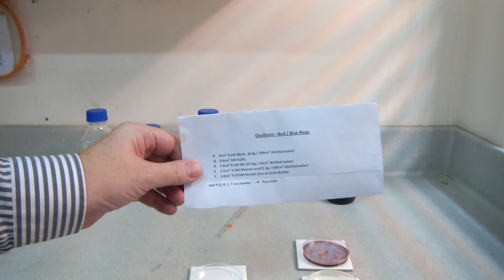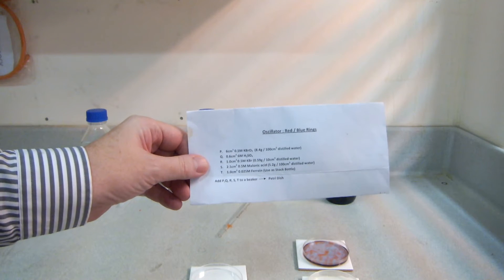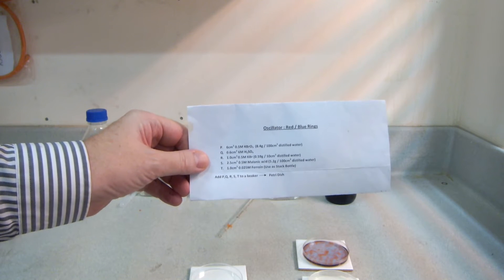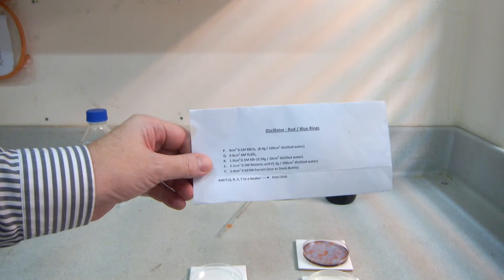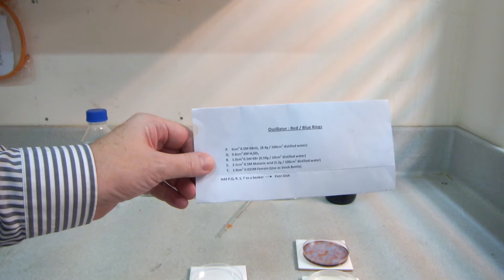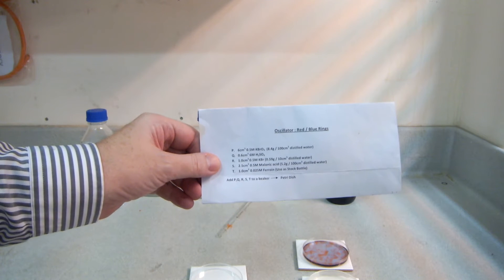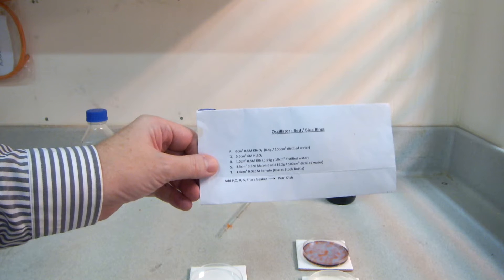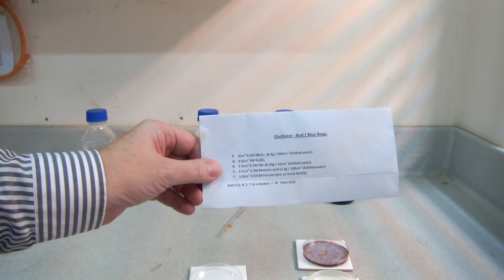When doing the Belousov-Zhabotinsky reaction in a petri dish, we're going to use the following reagents: 6 cm³ of 0.5 molar potassium bromate, 0.6 cm³ of 6 molar sulfuric acid, 1 cm³ of 0.5 molar potassium bromide, 2.5 cm³ of 0.5 molar malonic acid, and finally 1 cm³ of 0.025 molar ferroin. That's the commercially bought ferroin we'll be using as the indicator.